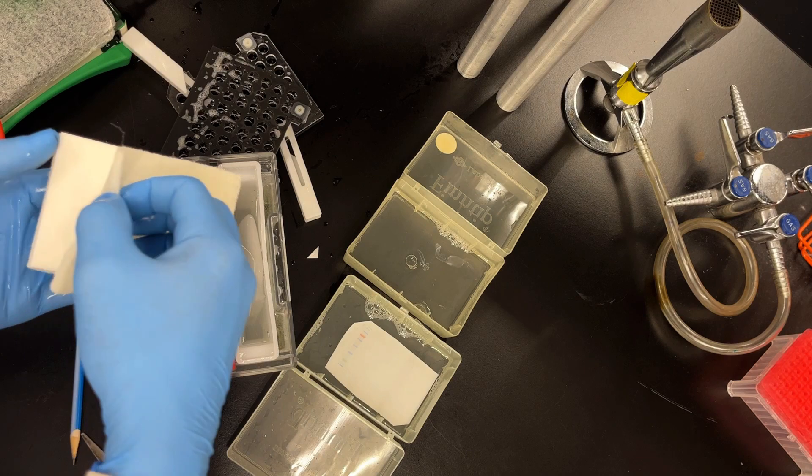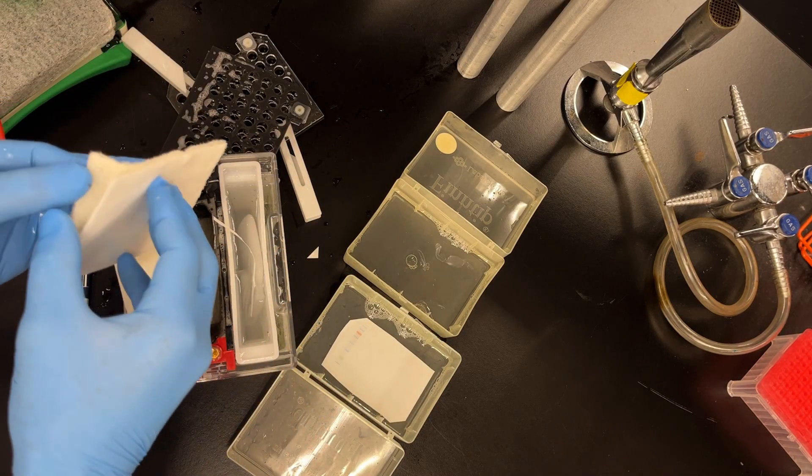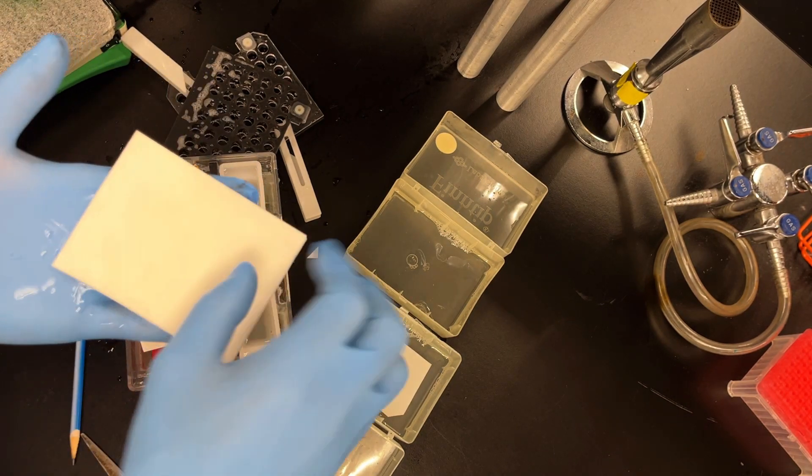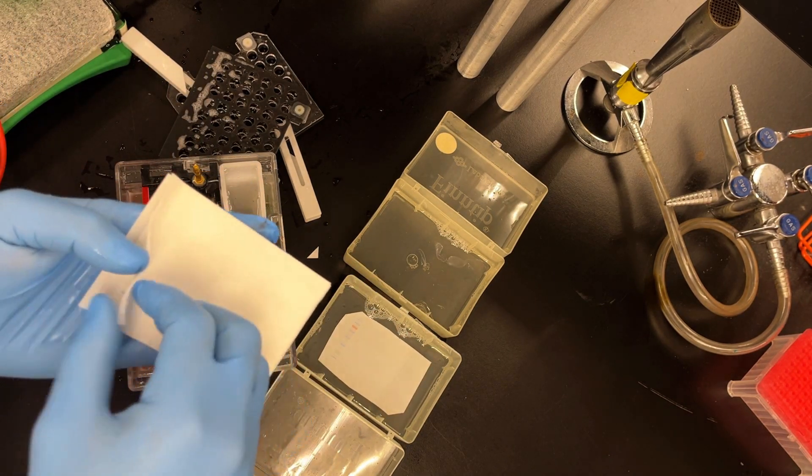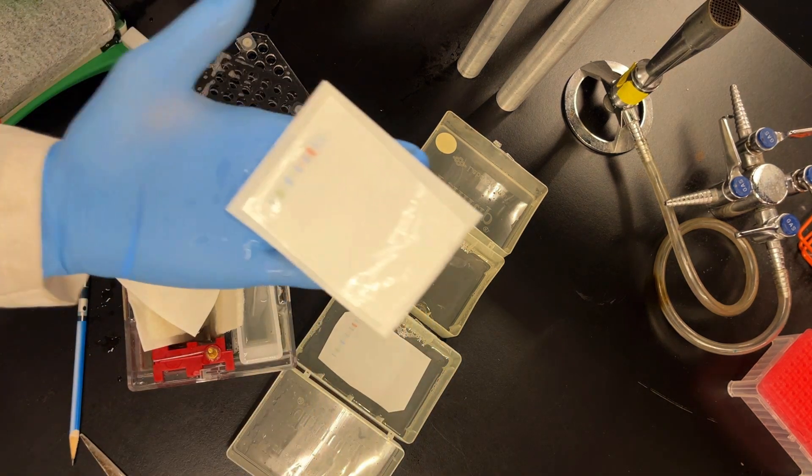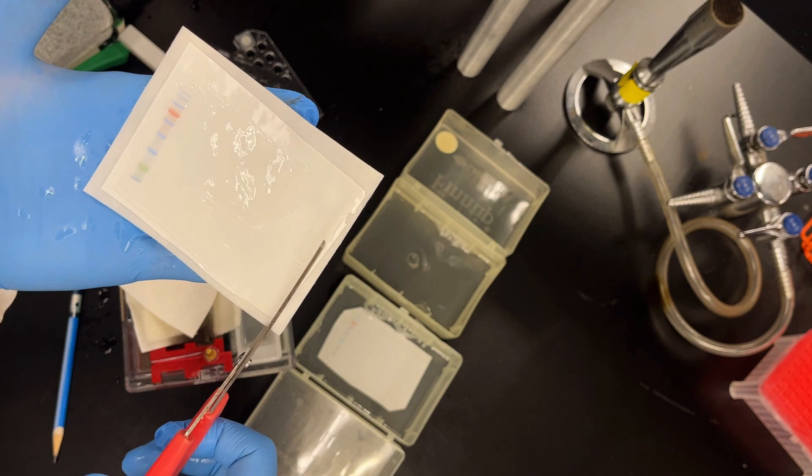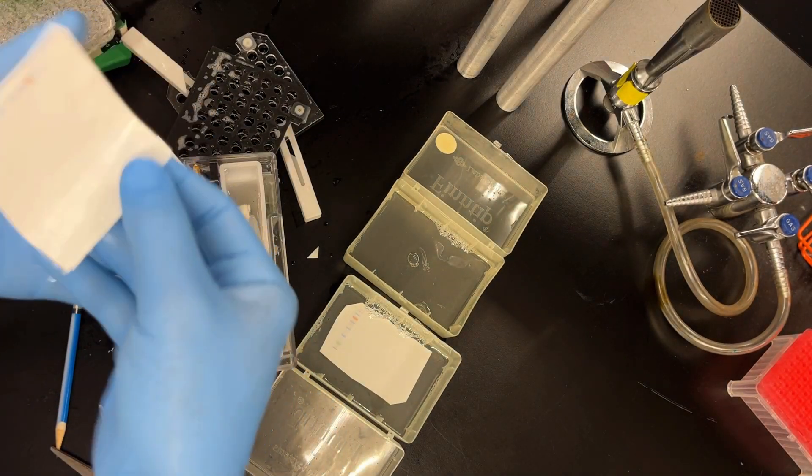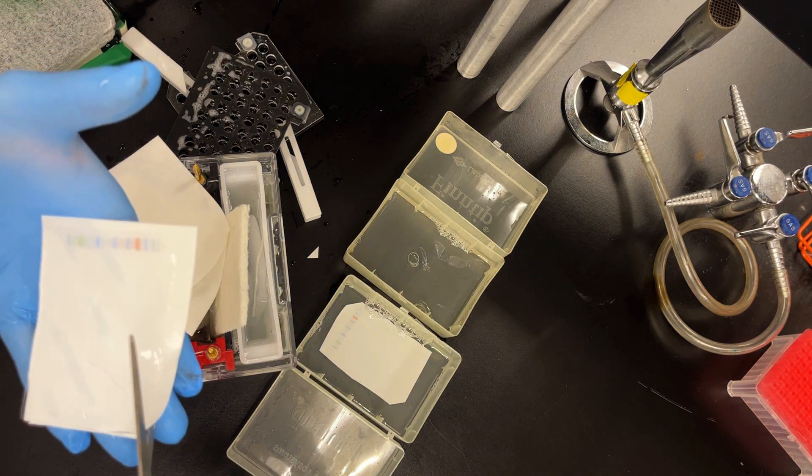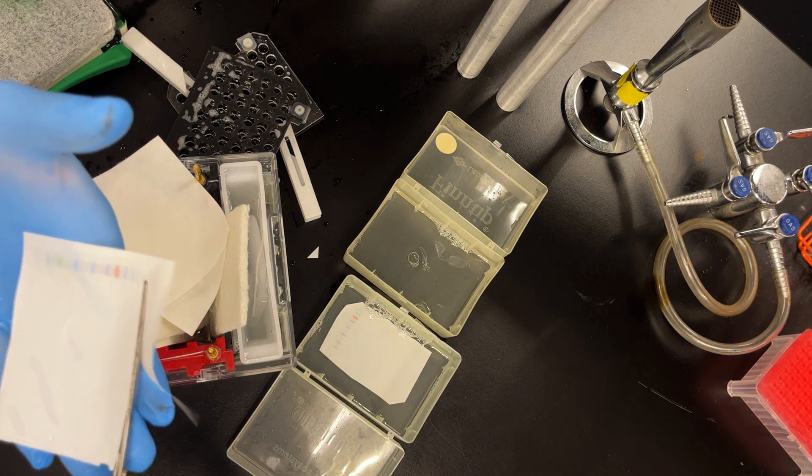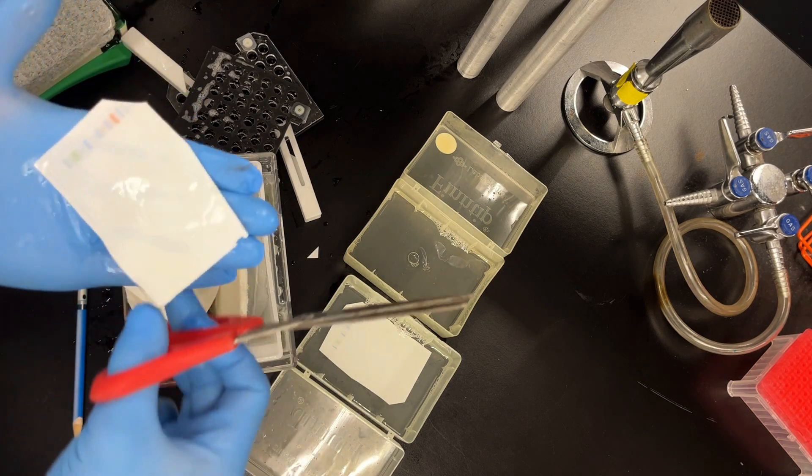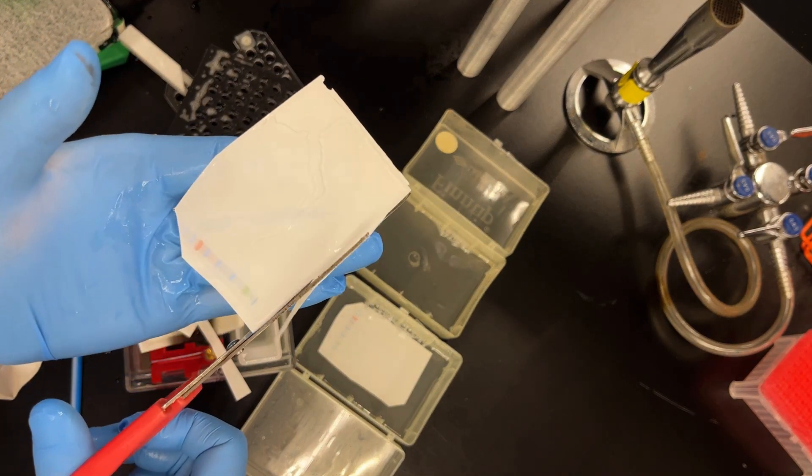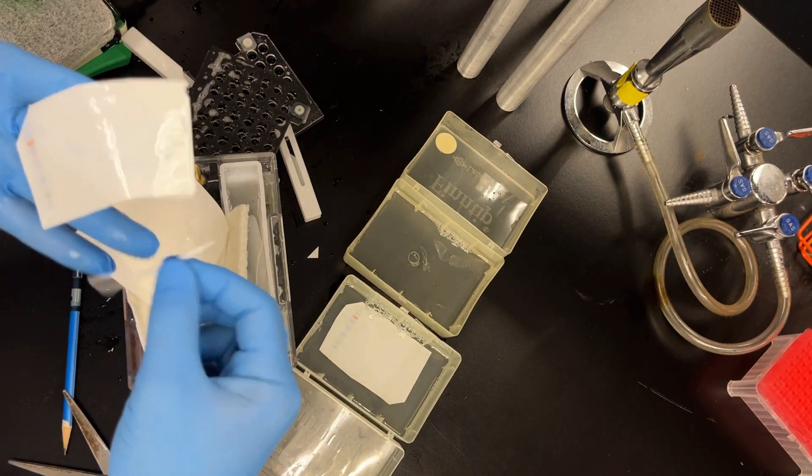Let's just repeat the process. I wonder if I was a little bit more careful with the filter paper this time. I was a little bit better. Slowly peel back. If you peel it back too fast, by the way, and then the gel sticks to the filter paper, the whole gel comes off. Although, again, we do have the pre-stained ladder, so it does transfer. Once again, cut around the gel. I decided it's too much to cut. Usually I cut it with the filter paper. I may have been in a rush. Notch my top left, because this is my gel number one. And then simply trim.